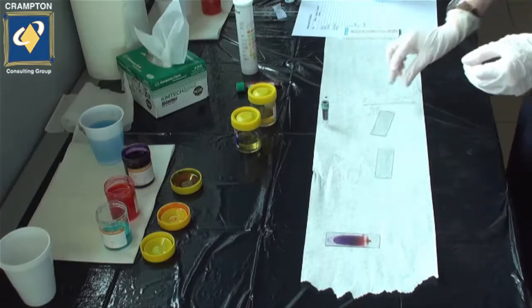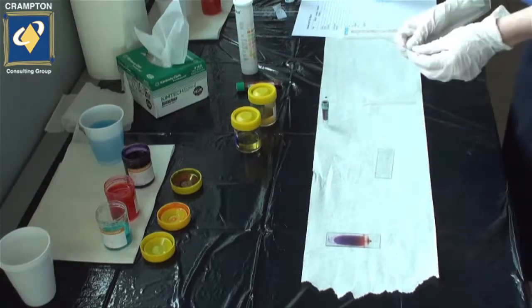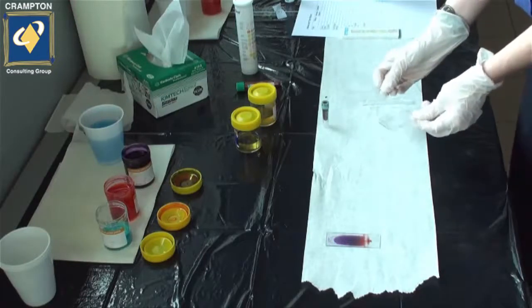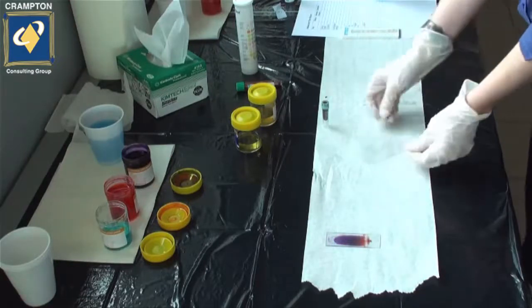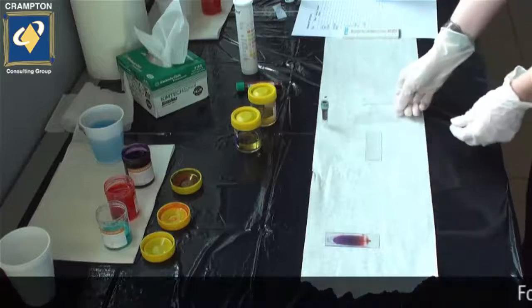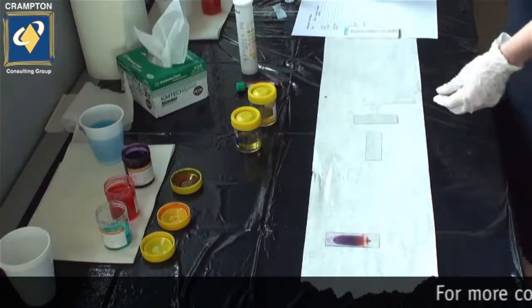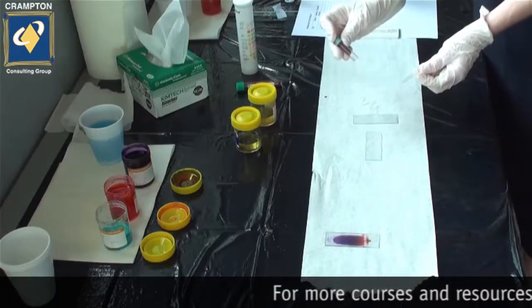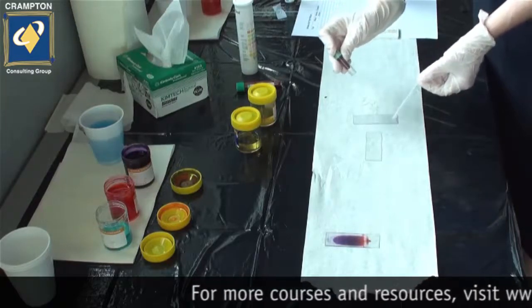So firstly, you must have two slides, a spreader slide and a slide for the actual smear. It is imperative that both slides are free from grease and clean. You will also need some blood that has anticoagulants in it, such as Lith-Hep or EDTA, and a pipette.